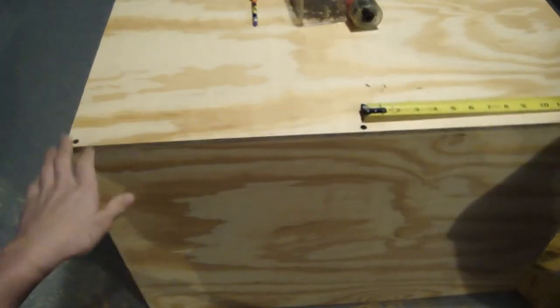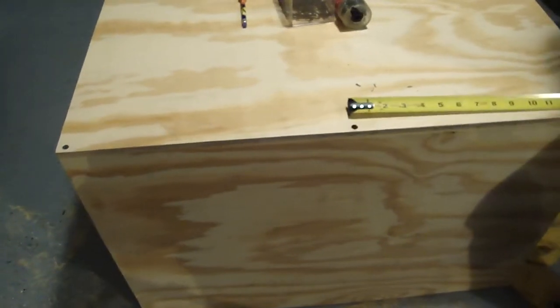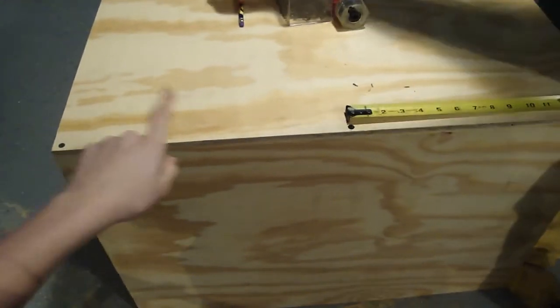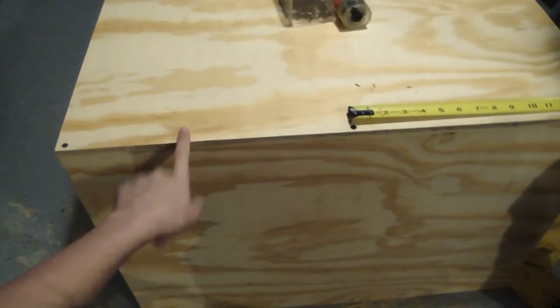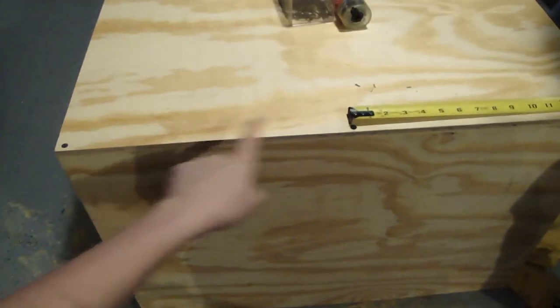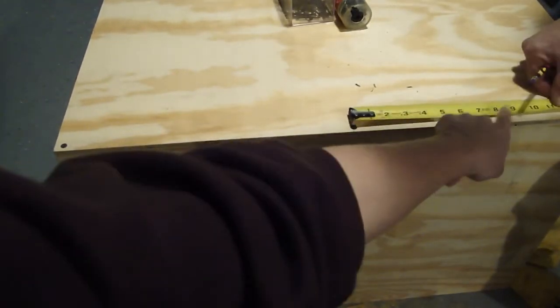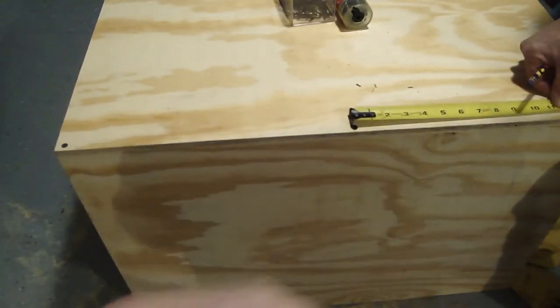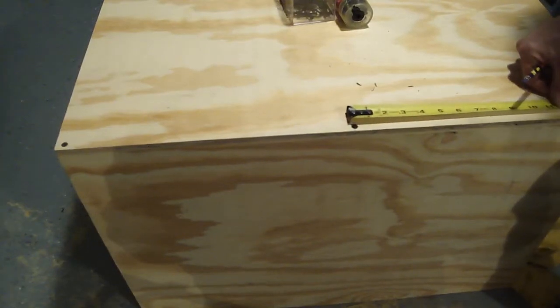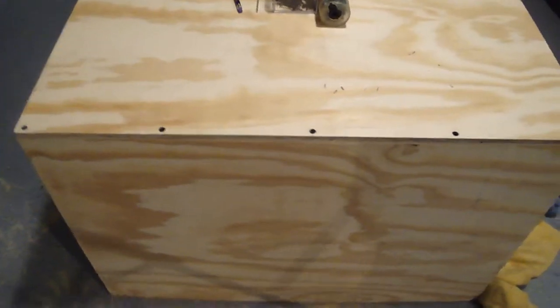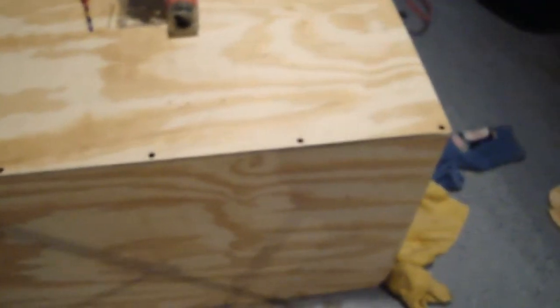We decided that it might be a good idea to put two more screws, one in between these two and one in between these two. So we're going to measure, mark that out, and put those screws in. So we've got five screws put in all the way, and this should be really secure.